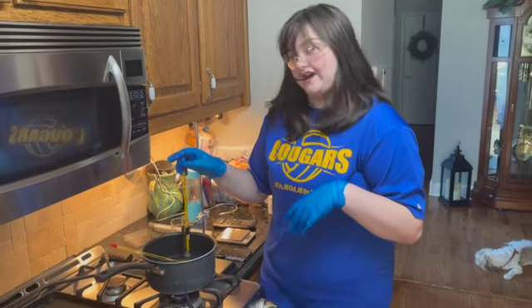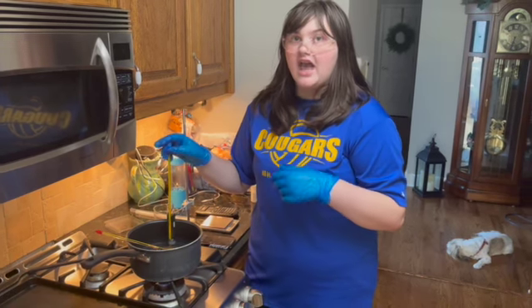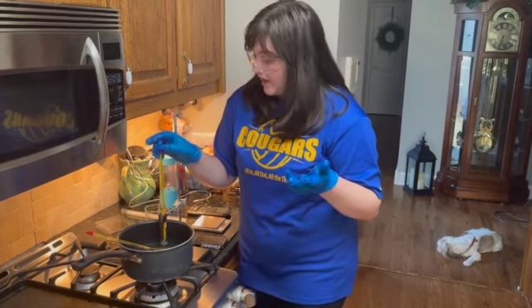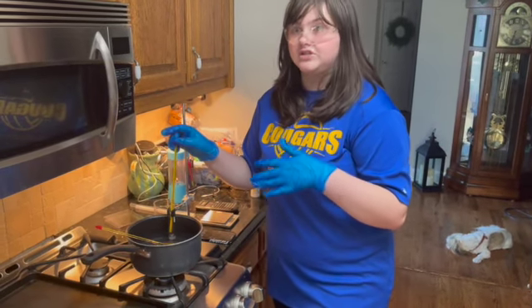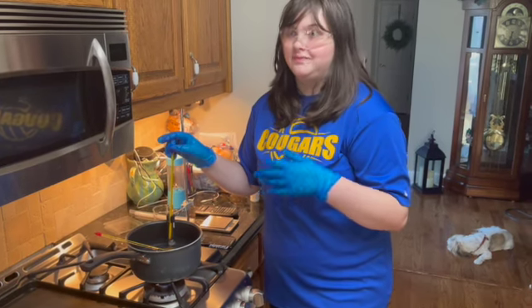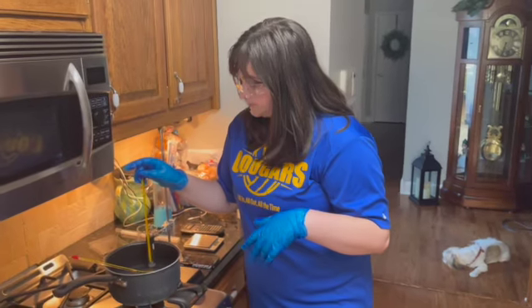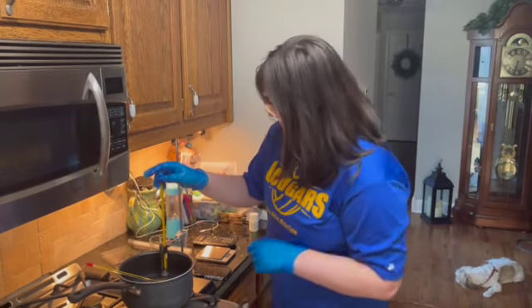And earlier, as I was putting this together, the odor was very penetrative, as stated from doing research on what it should be. But also getting that whiff just from opening the bottle was pretty much evidence to me that it is very penetrative.